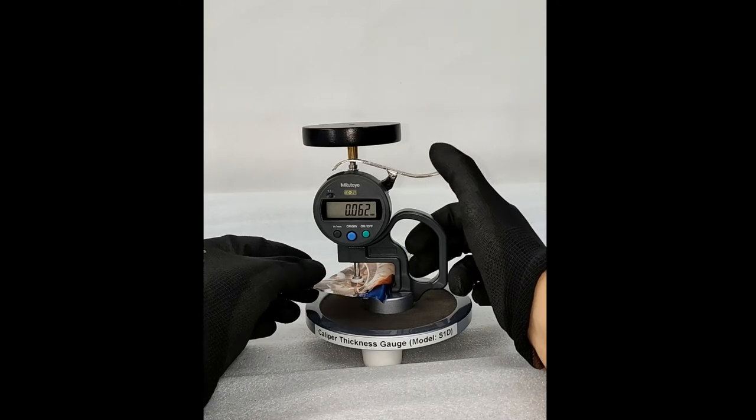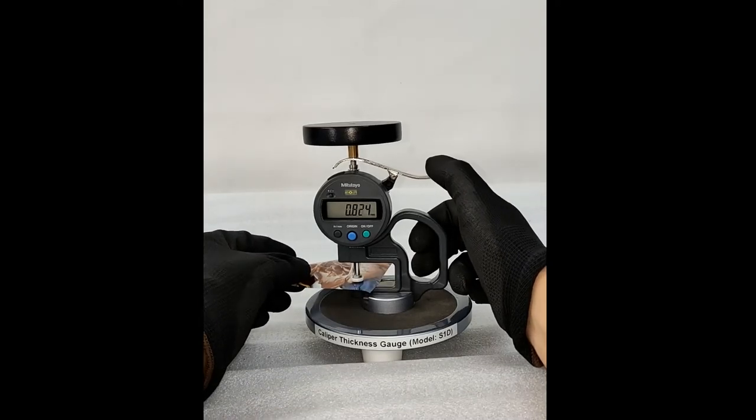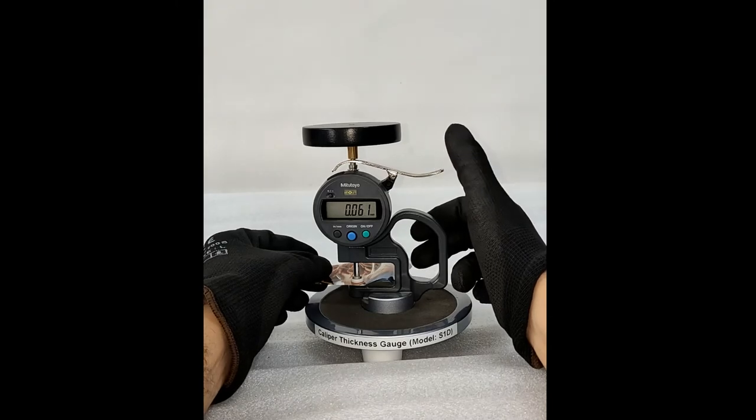This instrument can be used to test various flexible packaging materials, such as plastic films and laminates.